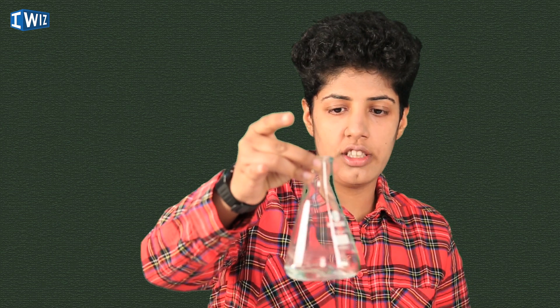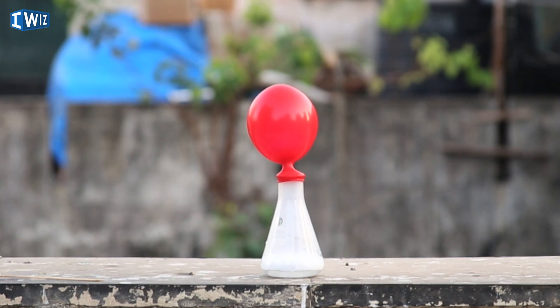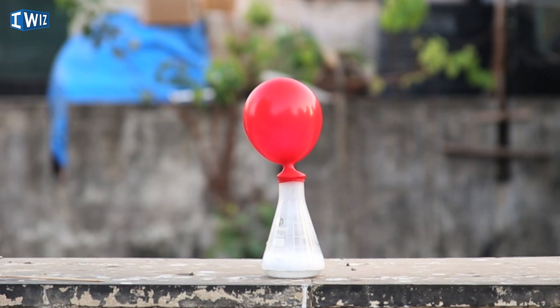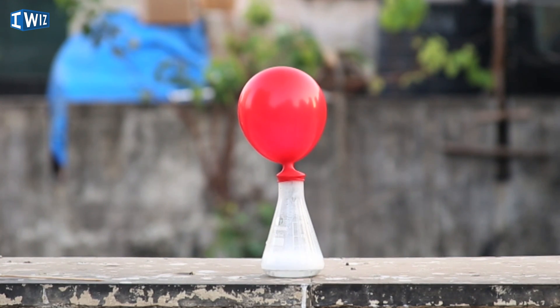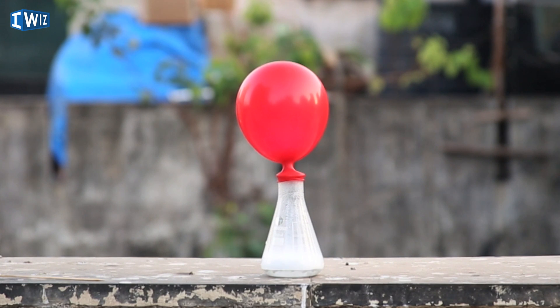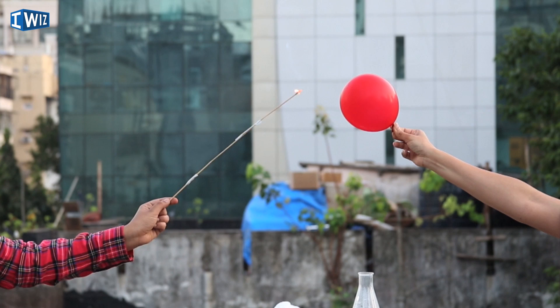But this doesn't allow me to collect the hydrogen gas. So I also have a setup over here which we can't do indoors, unfortunately, so we're going to go outdoors to do this. I have a lot of magnesium in this balloon and I have some hydrochloric acid in this conical flask. Let's just release the magnesium. You can see that the hydrogen gas is filling up in the balloon. Let's just give it some more time. I think that's done, so I'm going to remove the balloon. Let's see what happens when we light it.